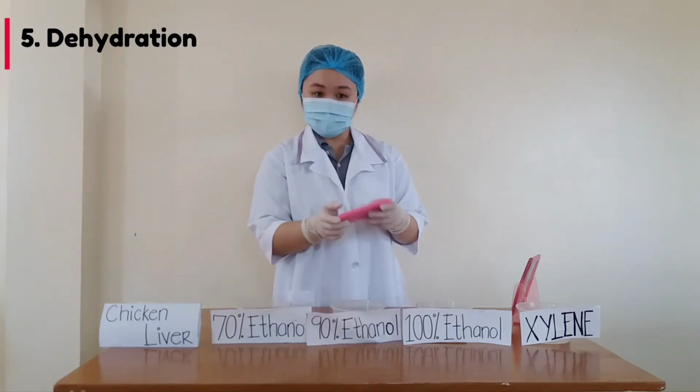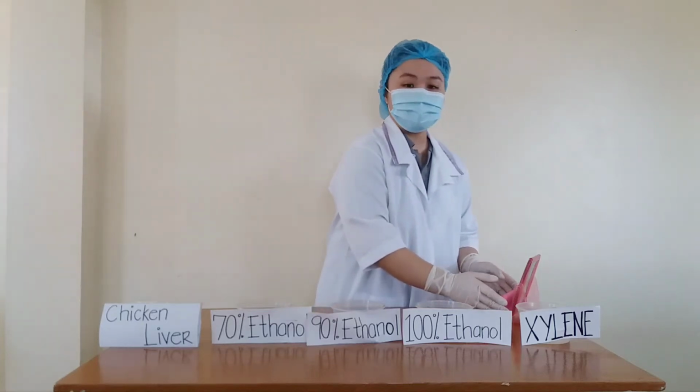Our 1 hour is up, and after the dehydration process, we will now proceed to the clearing of the specimen.